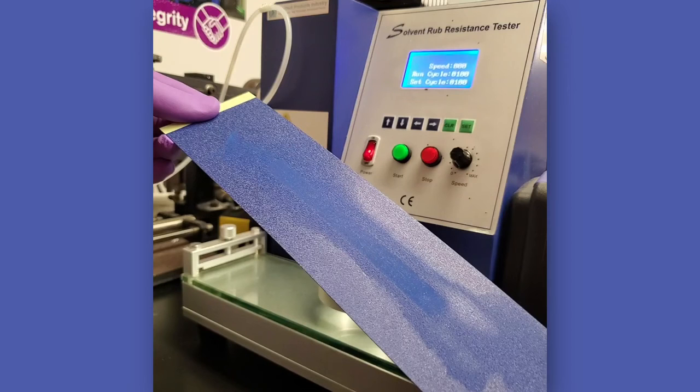It is recommended that any breakthrough that is observed, a ½ inch from either end of the stroke, be disregarded. Failures at these stroke turnaround locations are often heel break and are not indicative of the actual solvent resistance of the coating. The size or length of this area at each end of the stroke to be disregarded must be agreed upon between producer and user. If it is necessary, replace the cloth for each test or after a certain number of double rubs, as agreed upon between the producer and user.